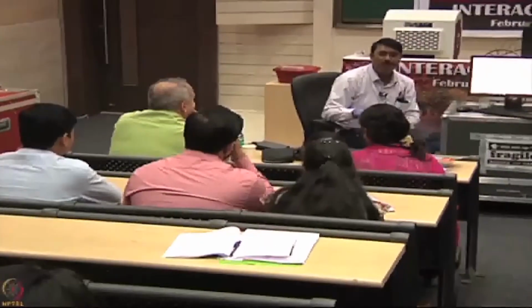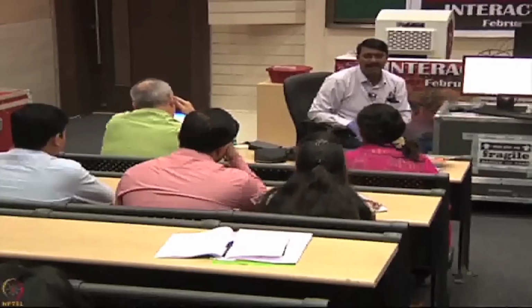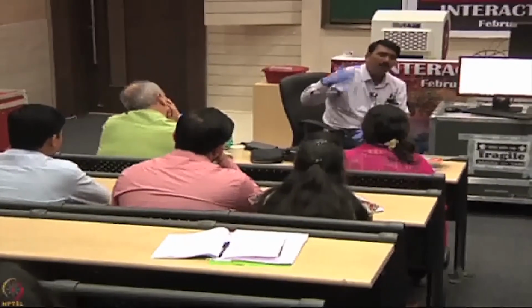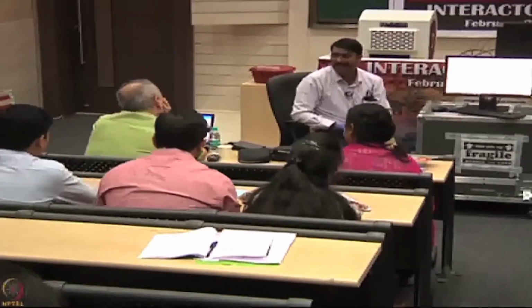When we test compounds, small molecules generally come in the nanomolar to micromolar range. At that time we start with around 100 micromolar.